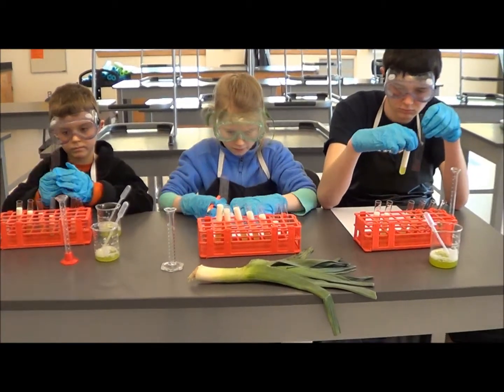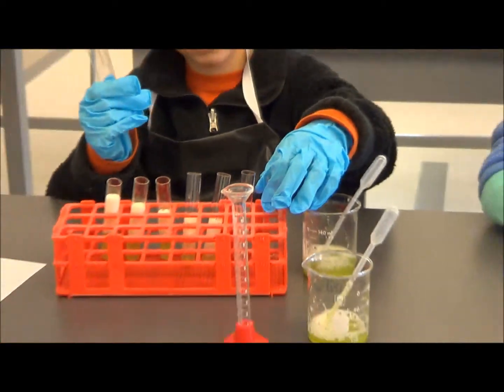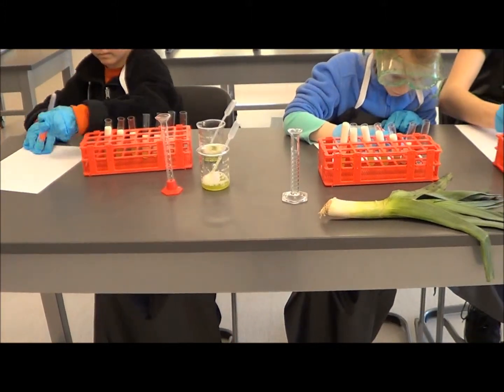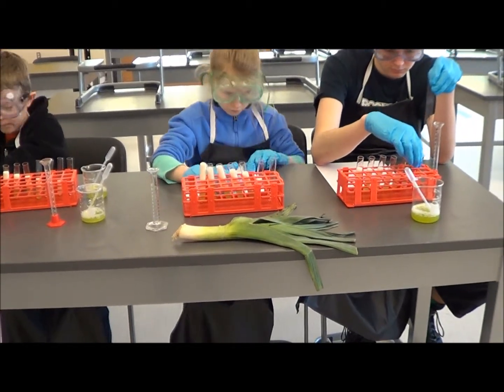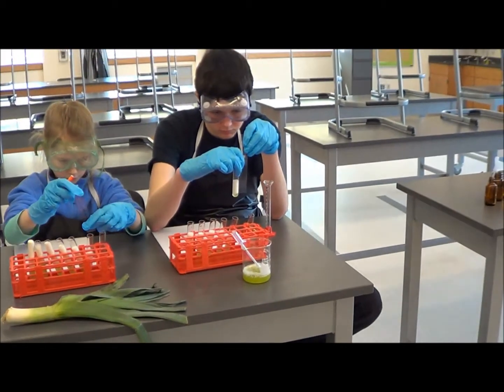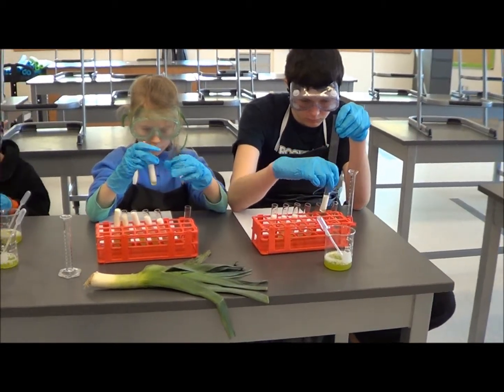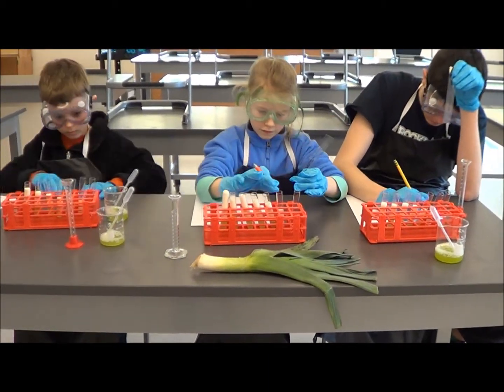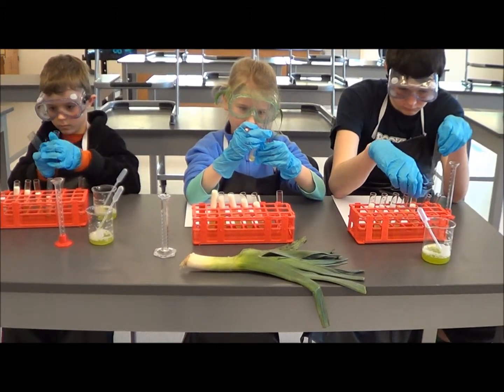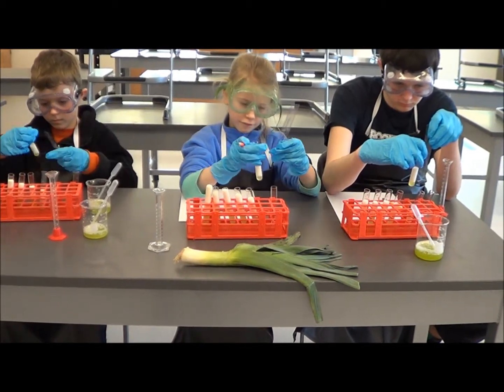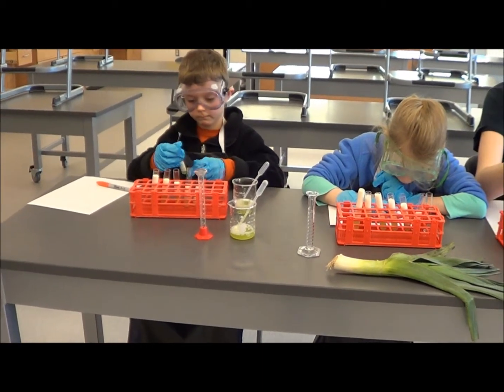Pick up the first one that says zero - how many bubbles do you have there? Zero, so you can write down a zero. The first one's zero. Then number one, can you measure just the bubbles? How many centimeters do you get? Four, very good, so write that down next. Science girl, how many did you get? About four and a half. Good, so you can write 4.5. How about you, science boy? Four. Very good, so you can write the number four.